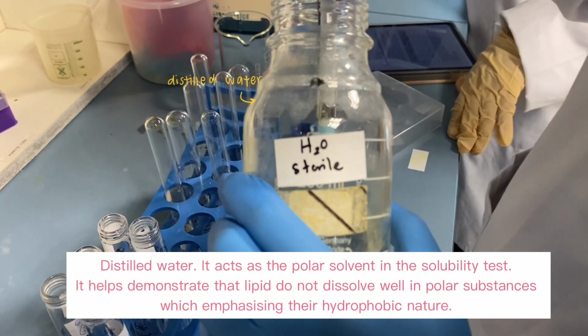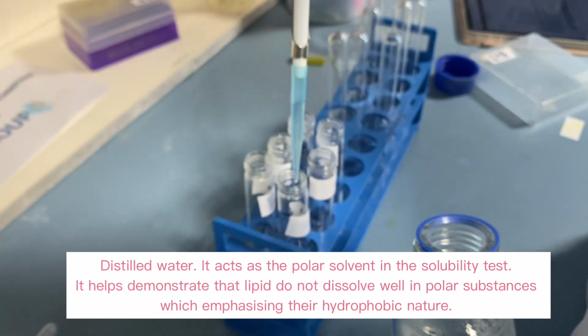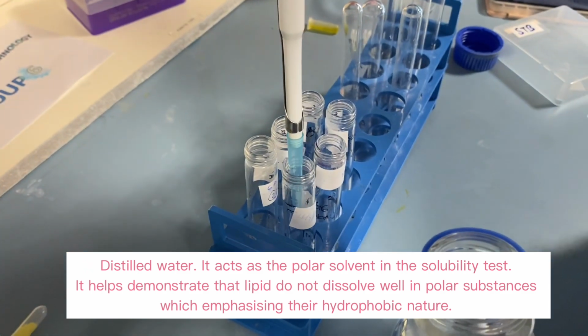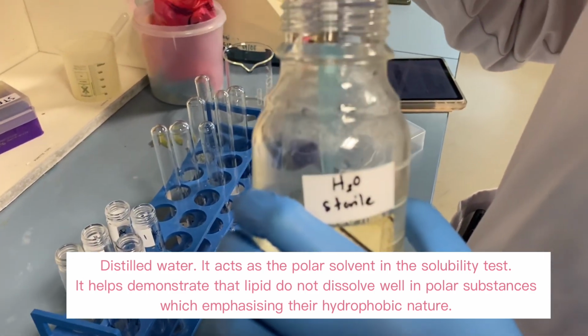The third material used is distilled water. It acts as a polar solvent in the solubility test. It helps demonstrate that lipids do not dissolve well in polar substances, emphasizing their hydrophobic nature.